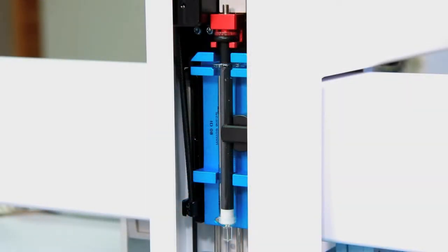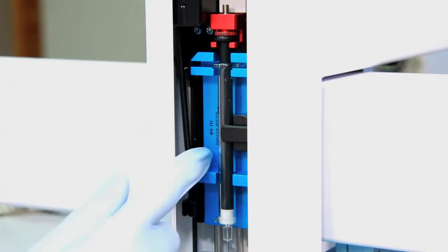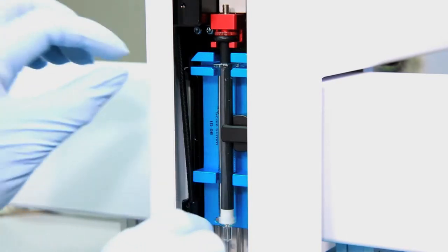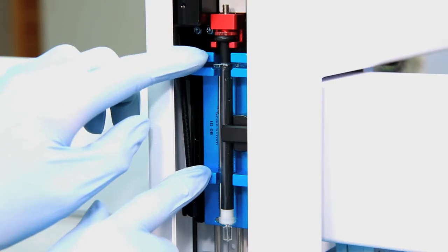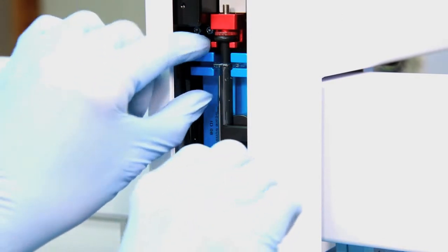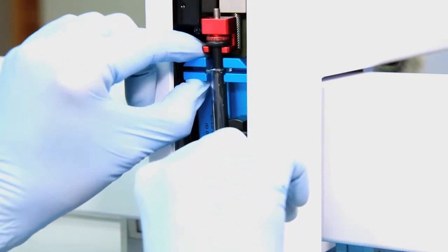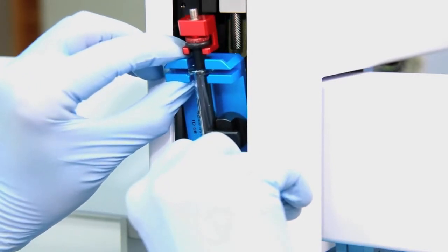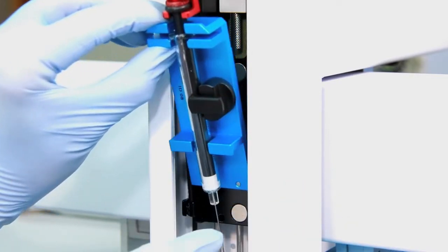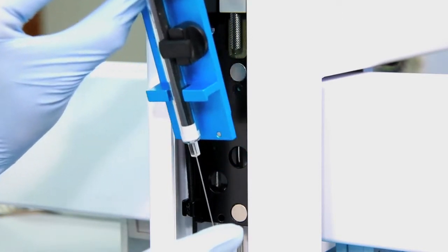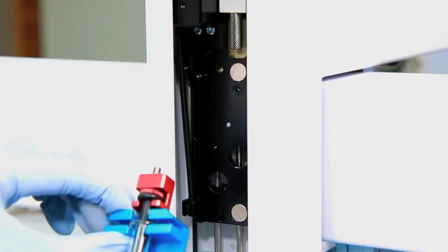Now you want to remove the syringe using this blue adapter. It's held on to the injection system by very tight magnets so you want to be sure you pull very tightly. You also want to be careful not to bend the syringe at the bottom. Then lift it up and pull it out of the holder.